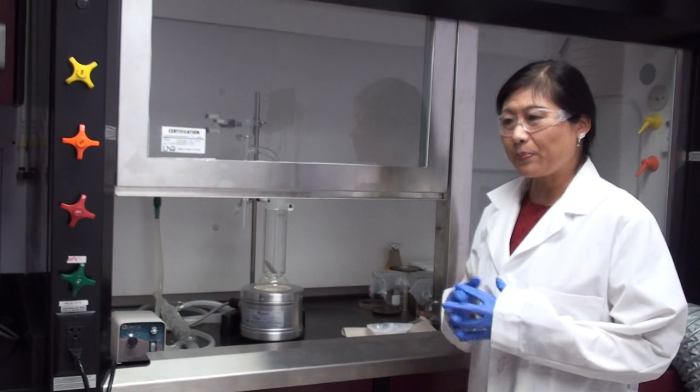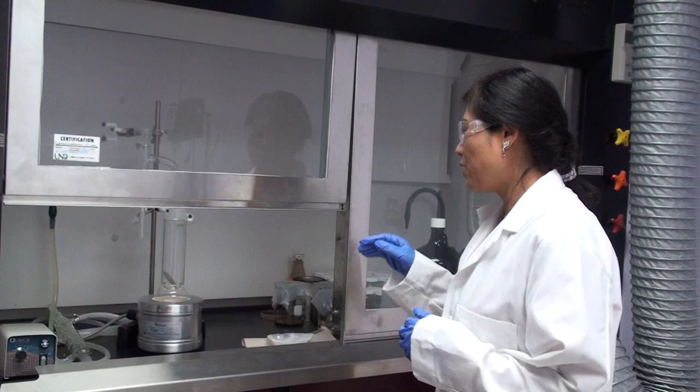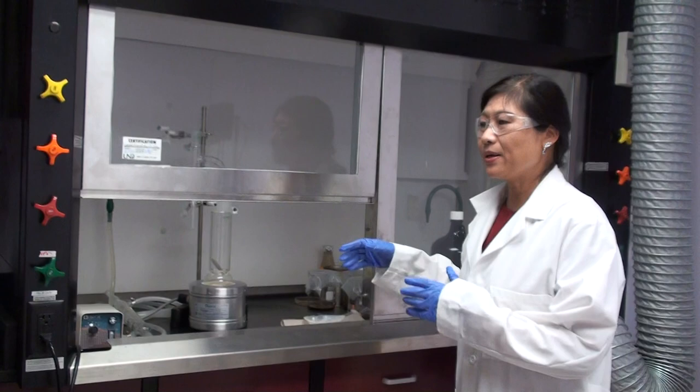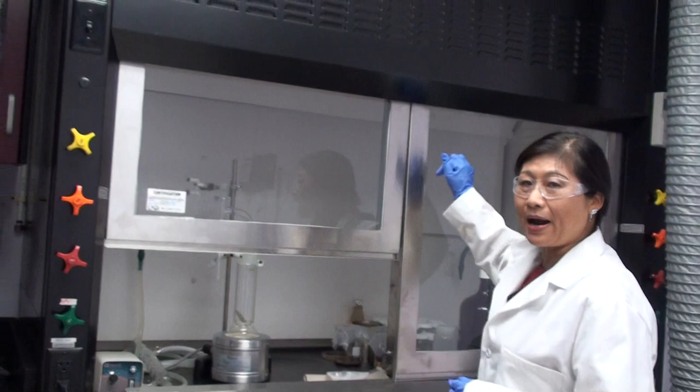The reason we want to use, because if you use small amount toluene solvent to clean the cores or mix some liquid or solution, this may smell stronger. So you want to discharge those smell out of the lab. We need to turn the air circulation on, and you need to remember to close this door.